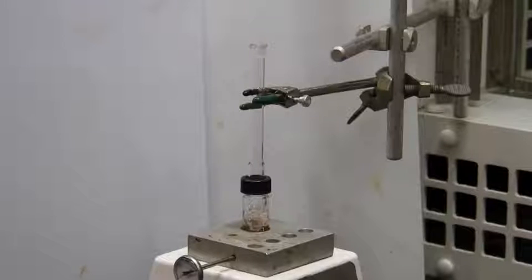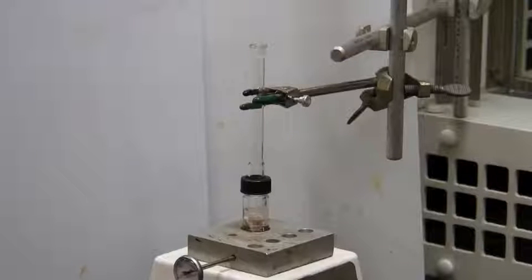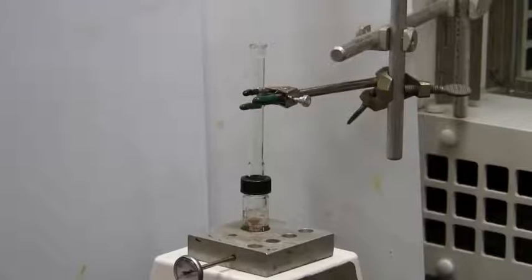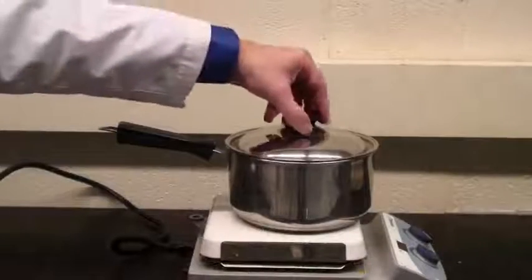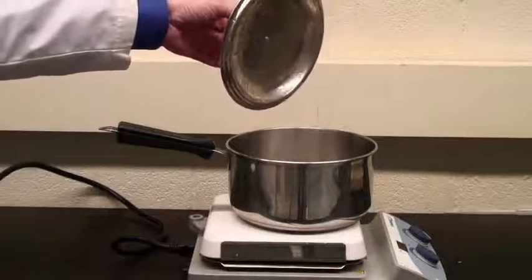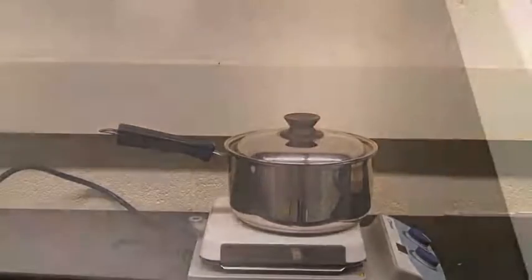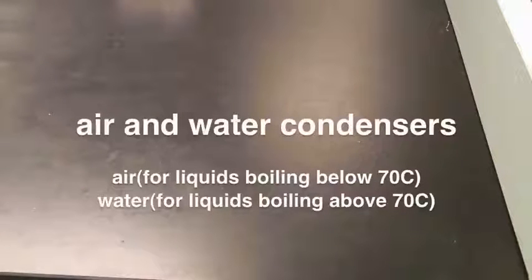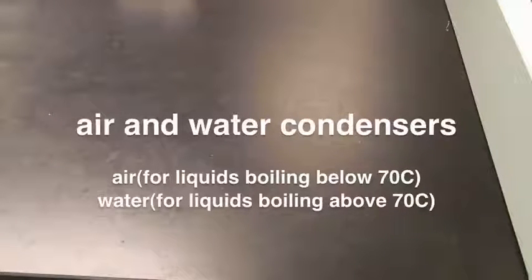Chemists do exactly the same thing, though we use many more solvents than water, so we have a whole range of temperatures to play with. The trick is not letting the solvent boil away. In a kitchen, putting a lid on the saucepan lets the steam condense and drip back into the pan. In the lab, we use condensers to catch and cool the solvent vapors and return it to the reaction vessel.